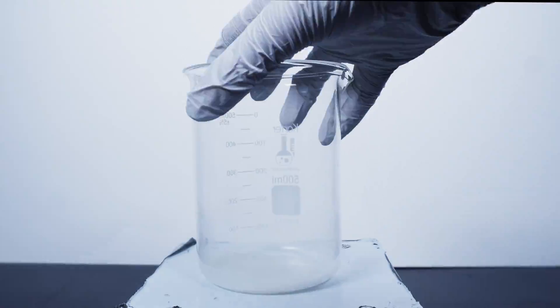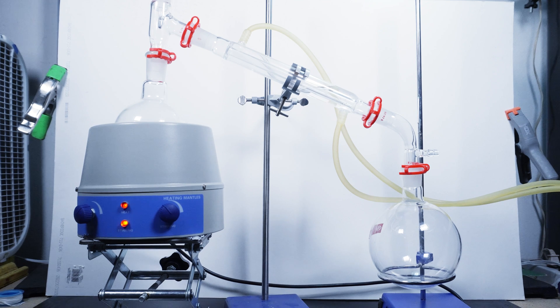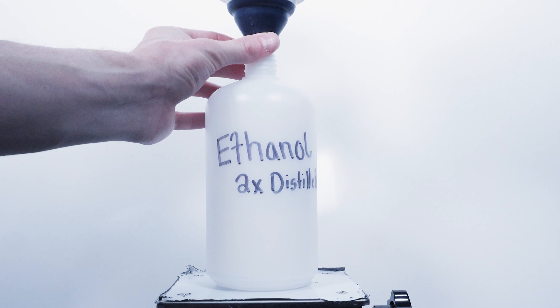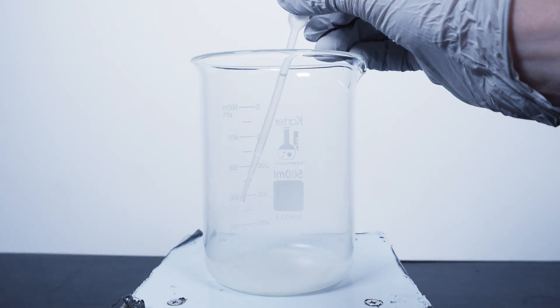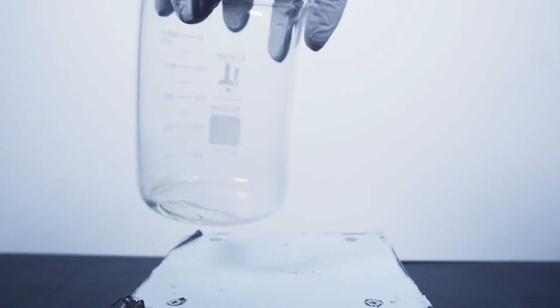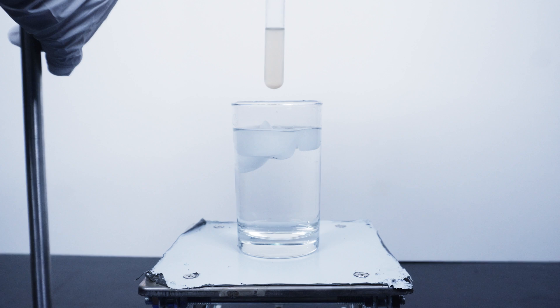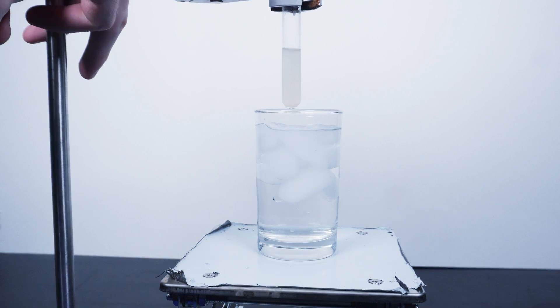Afterwards I have some pretty nice caffeine in the beaker but I need to recrystallize it and I needed additional ethanol. Luckily a few months back I did a project that involved extracting piperine from black pepper so I had some extra ethanol around that I needed to distill off. After about two and a half hours and two distillations I have ethanol that I'm pleased with. From here we need to dissolve all of the caffeine in ethanol — a good tip is to heat everything up in order to get it to dissolve. Next I put my ethanol in a test tube and let it cool to room temperature before adding it into an ice bath for about 30 minutes. This entire process takes 45 minutes in total and after you pull it out you should have some nice caffeine crystals forming. After this we need to filter off the ethanol and any extracted caffeine should be left.